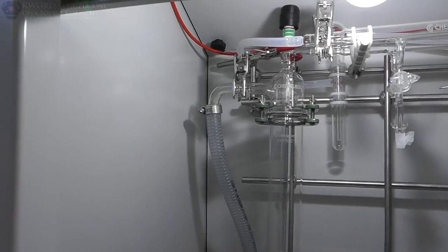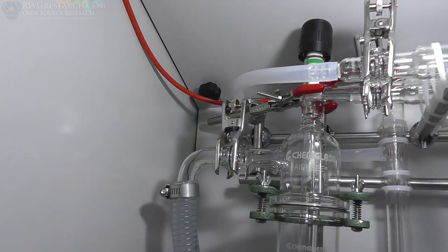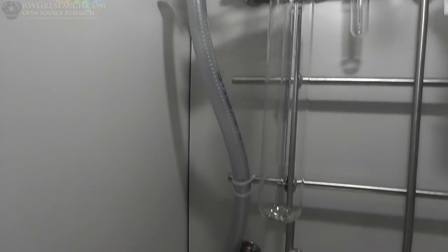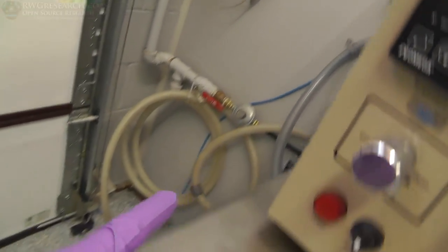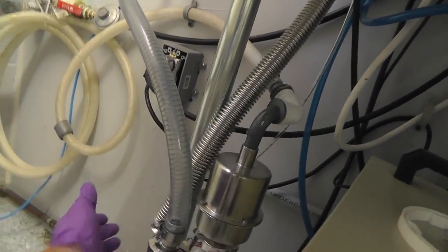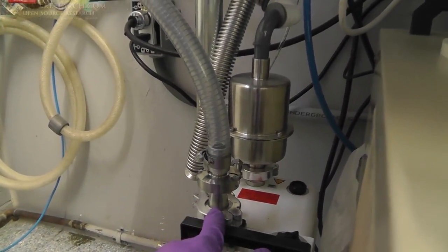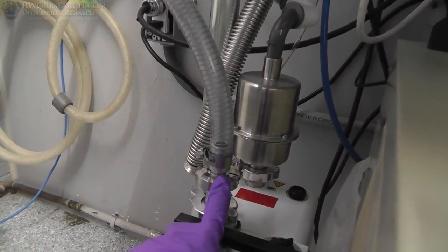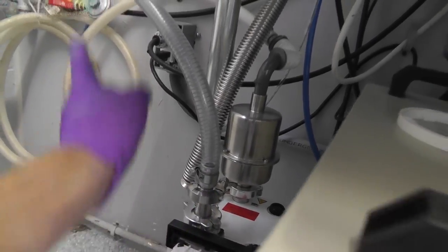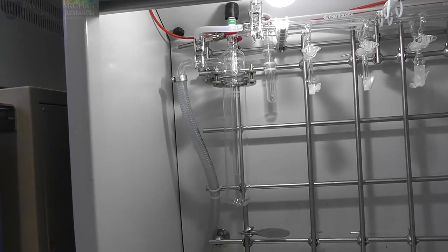Perfect. So here we are. I've put that clamp in, which I've mentioned earlier. I've put on the vacuum line, strapped it to this bar, out the hole, behind everything, down here, and I managed to just go ahead and stick it right in instead of to this pipe. It's kind of annoying, so we'll just plug it right in here with those same connectors. So this is a bigger connector down to a slightly smaller one. And then we got our VAC line all complete. Time to move on to the next thing.